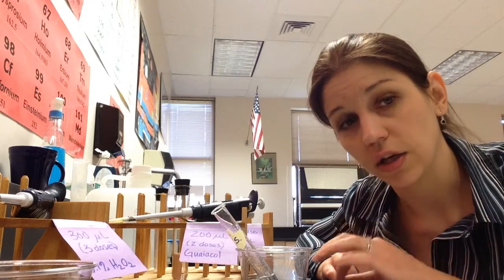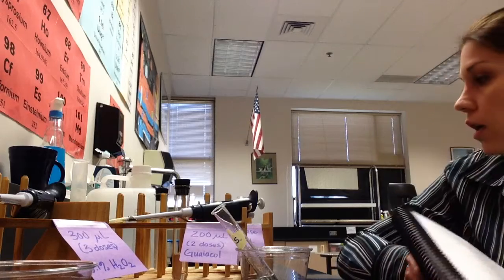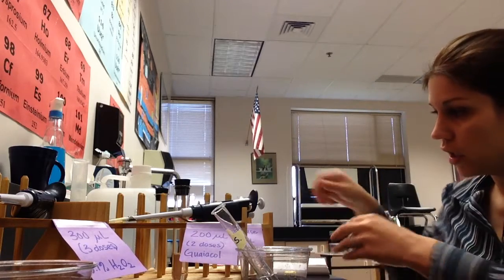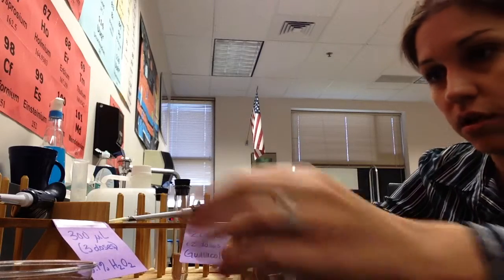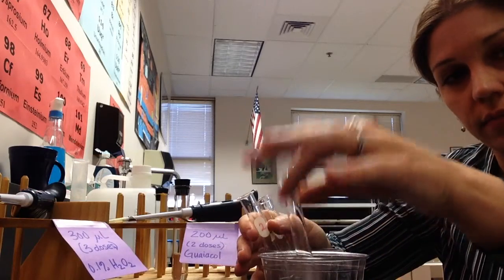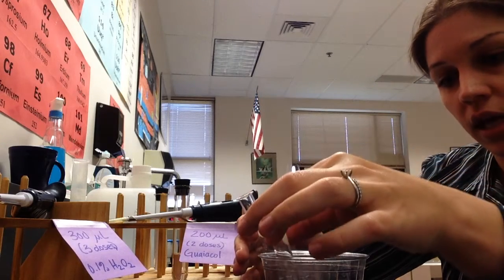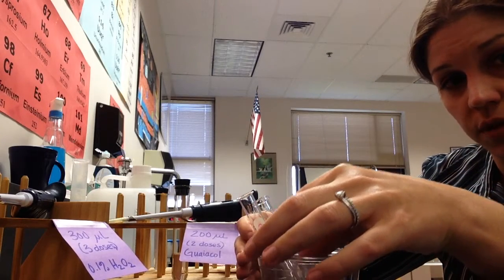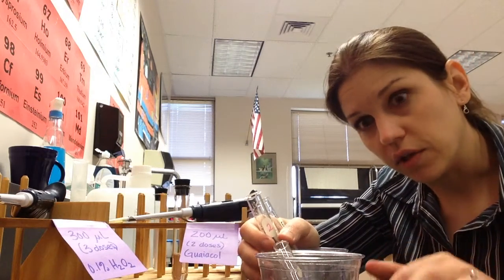So you're going to collect data in 30-second increments. At this point, you have your 2 test tubes, and you have also obtained your cuvette, because this is the one that actually fits in your spectrophotometer. This is certainly a 2-person job, and what I'm about to do, being 1 human, is not going to be quite as graceful as what you're going to do.